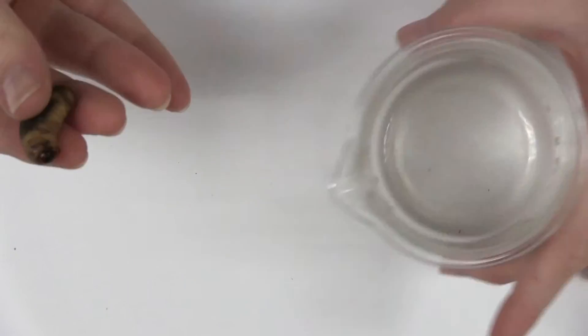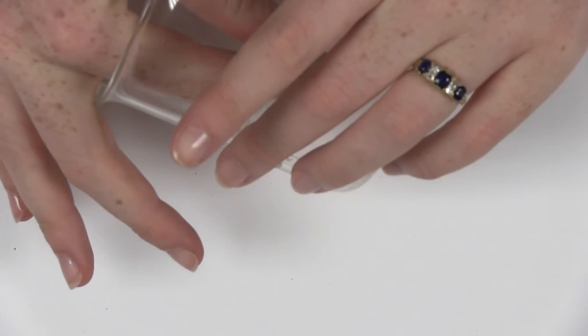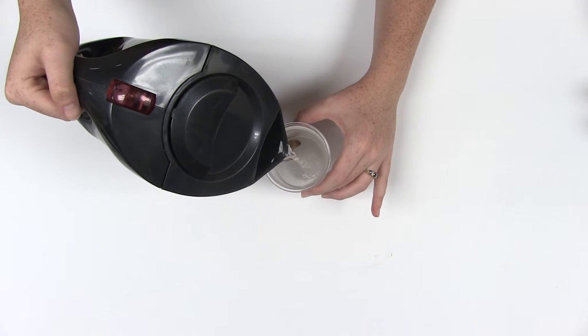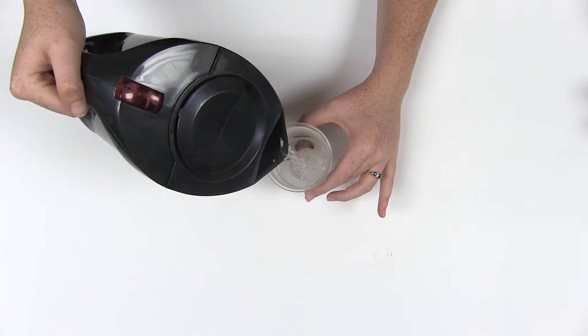First, put the grub in a beaker. Pour in some boiling water so that when the grub dies, it keeps its shape and color, which it will not do in ethyl acetate.